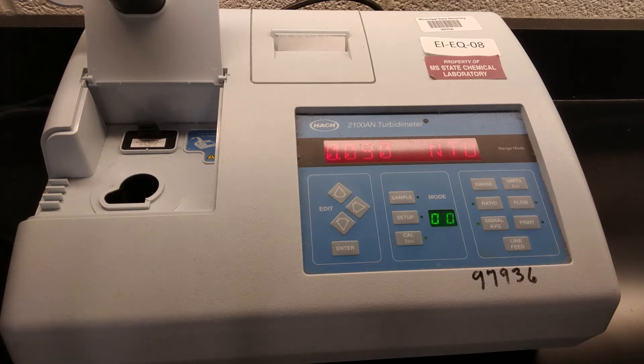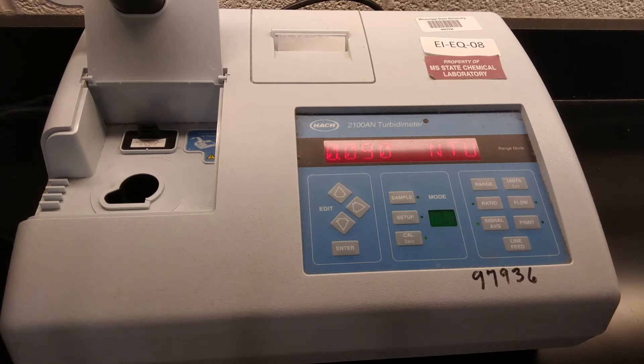So that calibration is fairly painless, I would say. Pretty easy. It doesn't take too long, all things considered, just six or seven minutes. Though you do sort of sit here and stare at a countdown timer for a lot of that time.